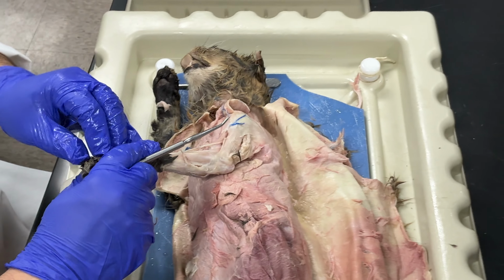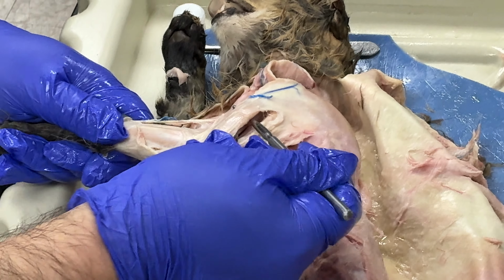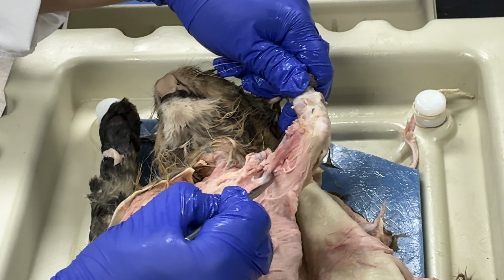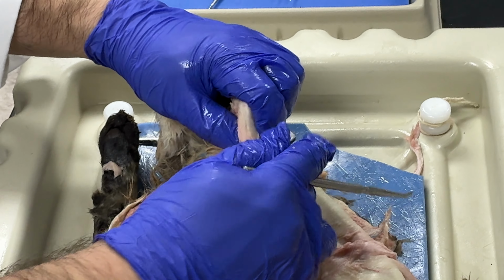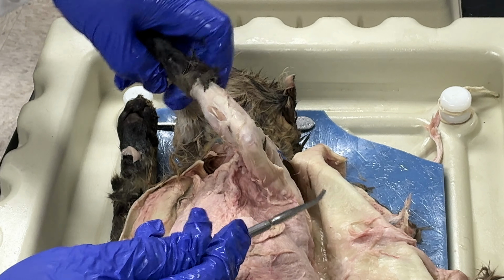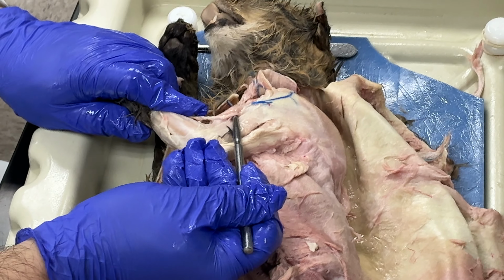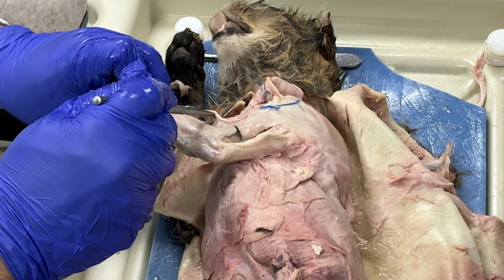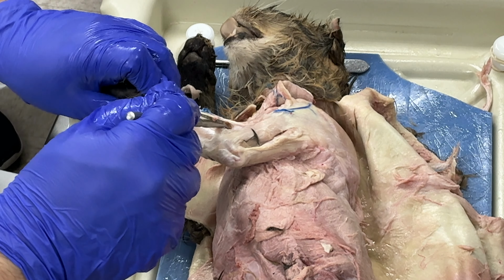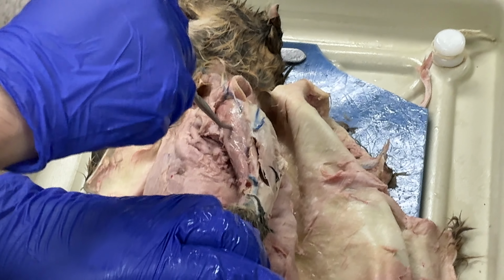So in the arm, this right here is part of my triceps. This is the lateral head of the triceps, and then this is the medial head of the triceps, and this one back here is the long head of the triceps. So that's my triceps brachii. Over here, this muscle is called the brachialis. This is the brachialis muscle. This muscle that's attached to it is very thin. It's called the brachioradialis muscle. And then next to my brachialis, this muscle is my biceps brachii.